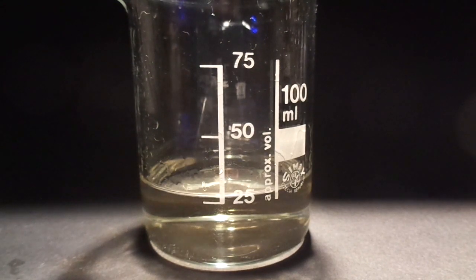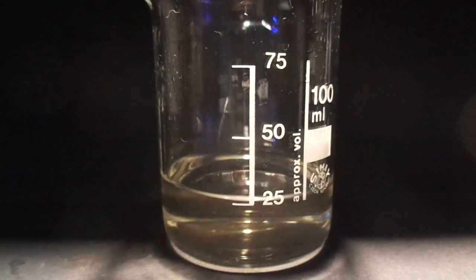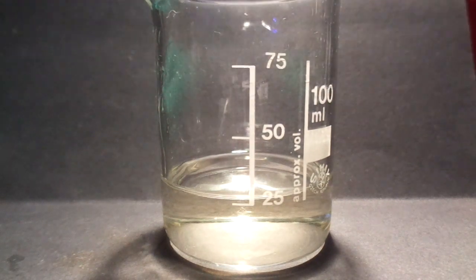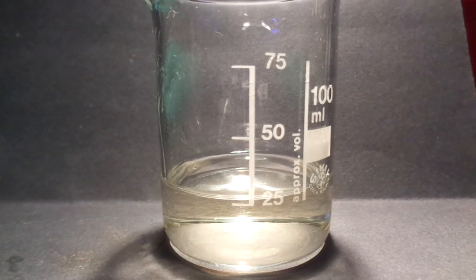I have distilled the excess ethanol from the mixture and as you can see it is slightly yellowish viscous liquid, which I hope contains quite a bit of the triethyl citrate.